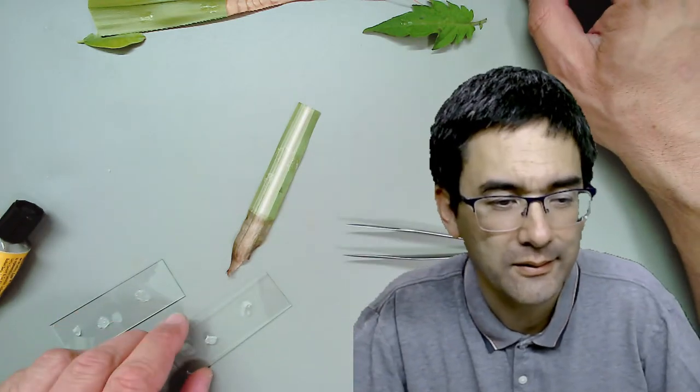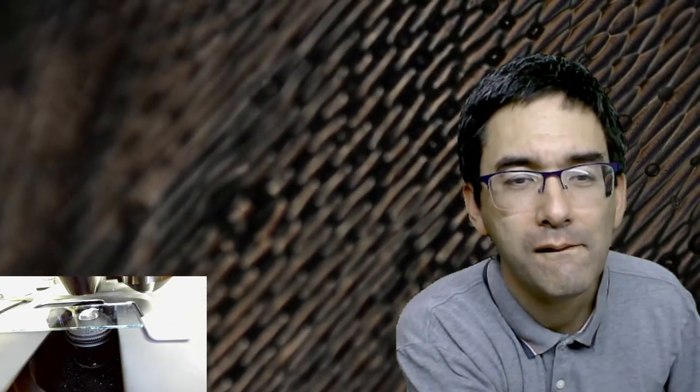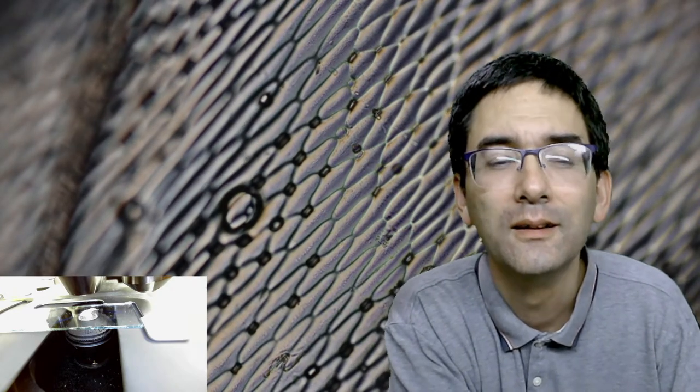Let's give it a try - and here we go, also quite nice. Let me open this a little bit brighter. Look at these cells here. How many of you are able to see the stomata? Plenty of them. Almost looks like fencing. Greetings from Germany. Greetings from Austria.